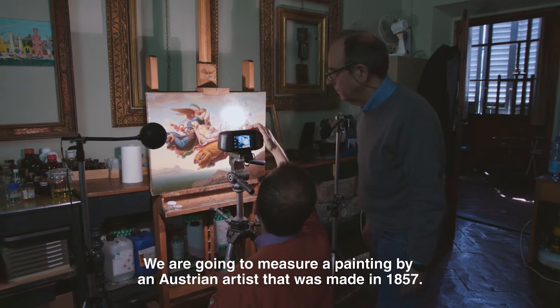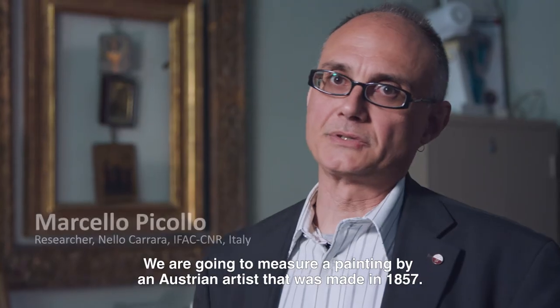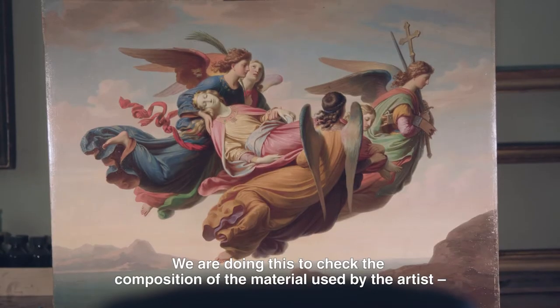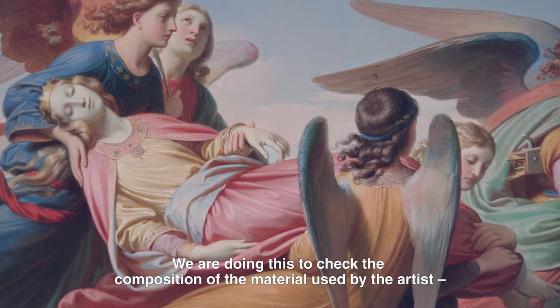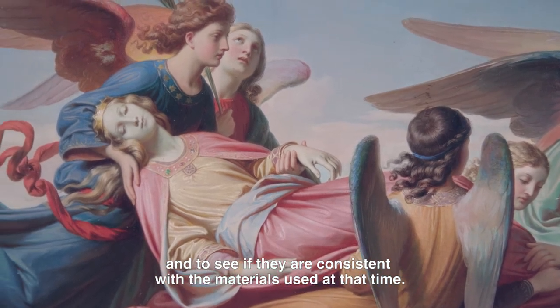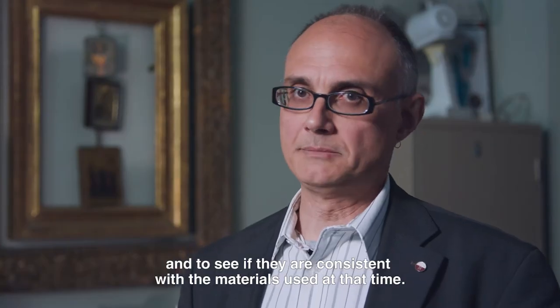We are going to measure a painting by an Austrian artist, made in 1857. We are doing this to check the composition of the material used by the artist and to see if they are consistent with materials used at that time.